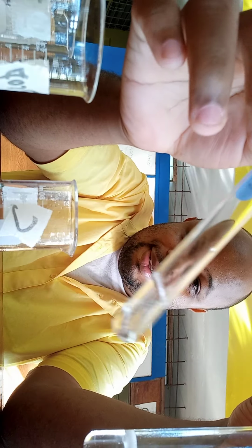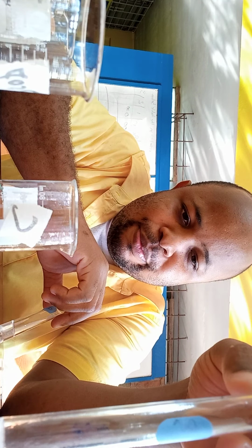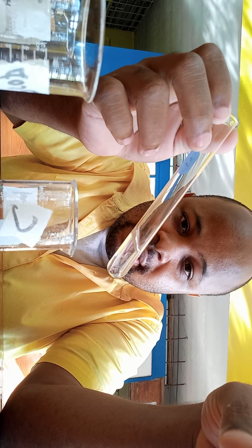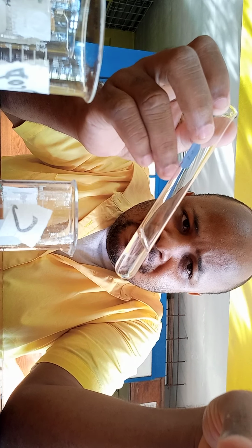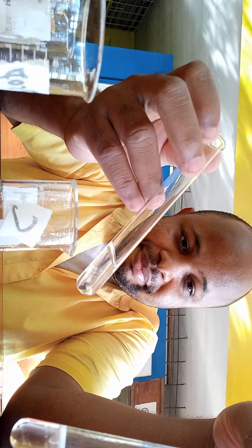Right. So this, I'm assuming, is the weak acid. So I'm assuming any reaction with the one that is supposed to be the ketone would have been any remaining sulfuric acid that we had added to the container. Because remember, the sulfuric acid is the catalyst. So it would have been there. So in this one, at the end of it, you would have had a mixture: you would still have the sulfuric acid remaining, which is a catalyst, but also the ethanoic acid.